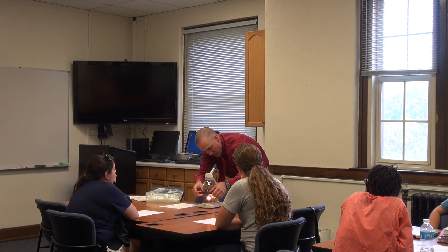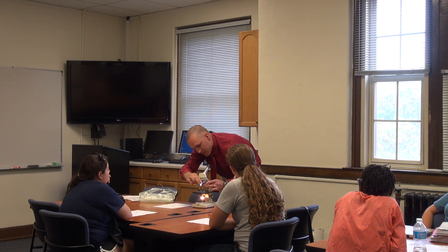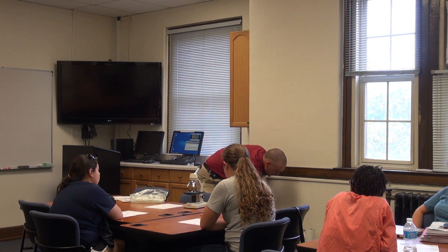I see whatever it is that I need to see. It's now time to tear the whole assembly down. I first move the objective lens back to its smallest setting to allow for the most distance. I remove the clips, remove the specimen, carefully set it to the side, turn off my power source, and remove the cord. I would prefer that you wrap the cord and cover things back up. Remembering good safety technique — grab the arm and the base in order to transport.